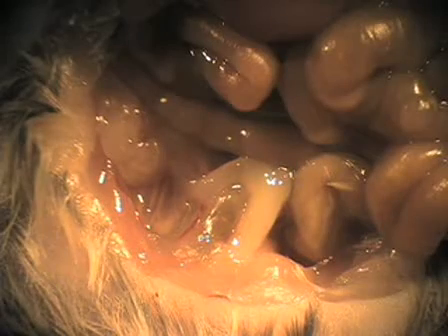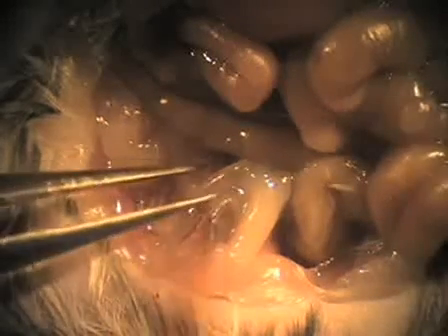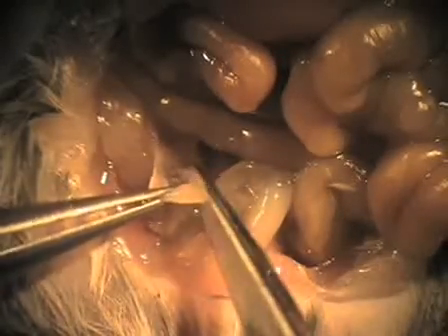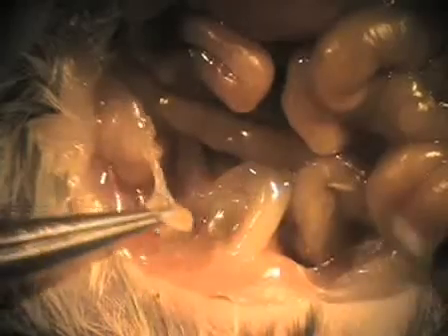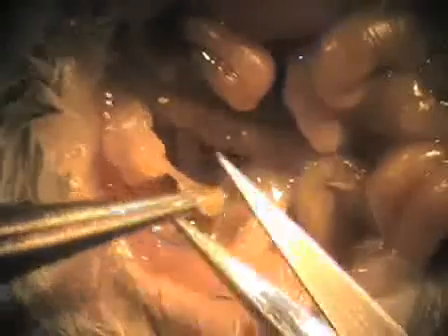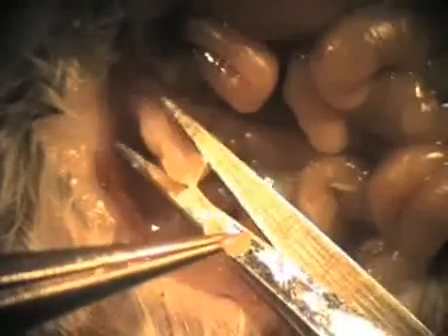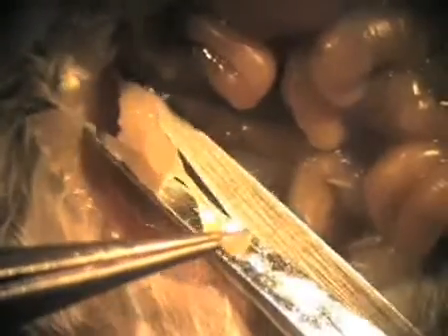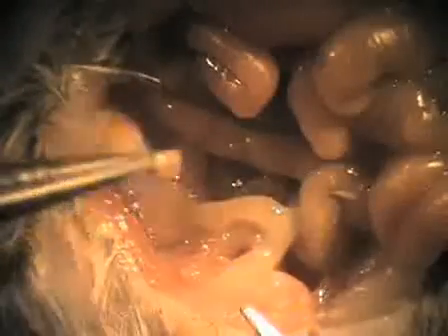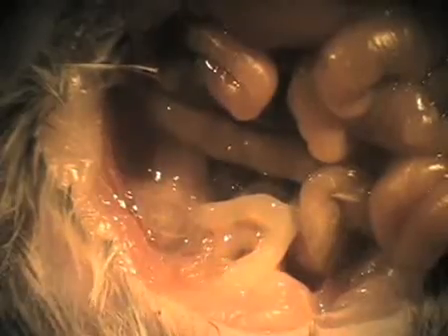The uterus is Y-shaped in the rodent, so I'll be taking part of the uterus. When that is cut, the oviduct looks like spaghetti. I'll be trying to take part of the oviduct. I'll take the oviduct and part of the ovaries, which is encased in fat. The other side is going to be taken at this point.